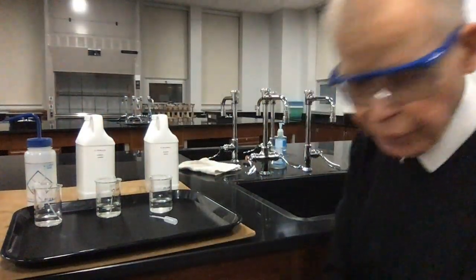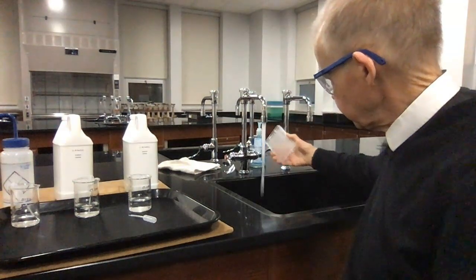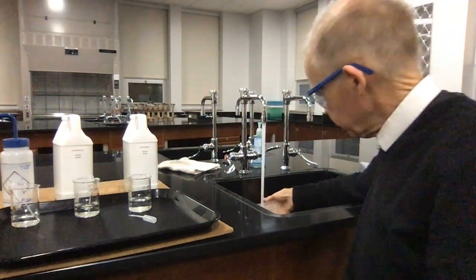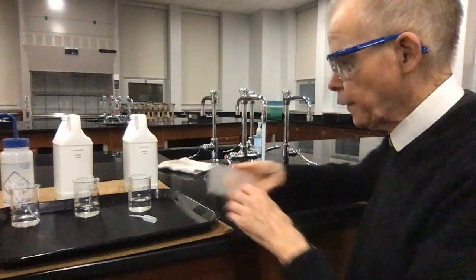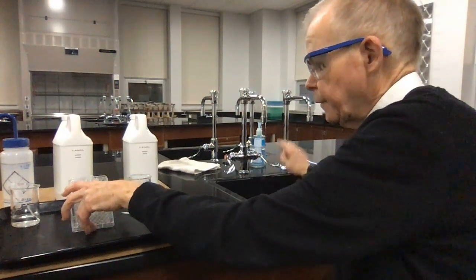Now, to wash this out, all I have to do is shake it upside down real quick. My solution's in the sink. I do a little rinse, shake it a couple times. And my well plate's pretty clean.